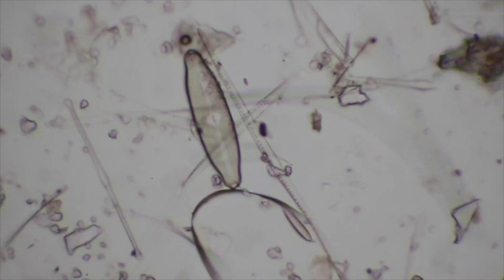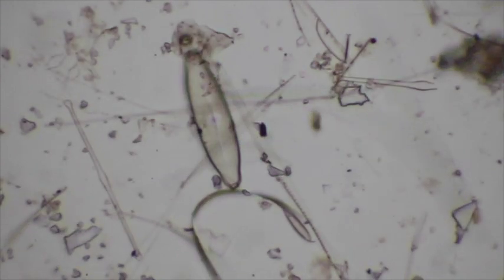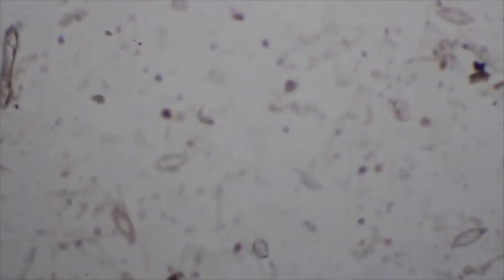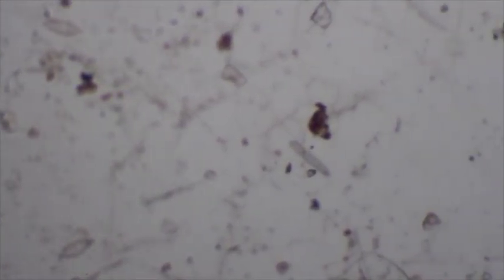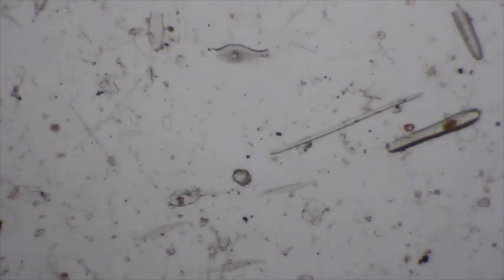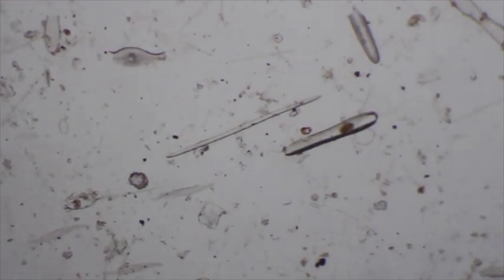Okay, another one in there. See that long guy right there to the left of him too, so there's more than one in here that you can identify. Back to the 10x magnification. And you can see that there are tons and tons of diatoms in these samples. So the diversity is amazing. This is just one little pond being Boulder Creek.